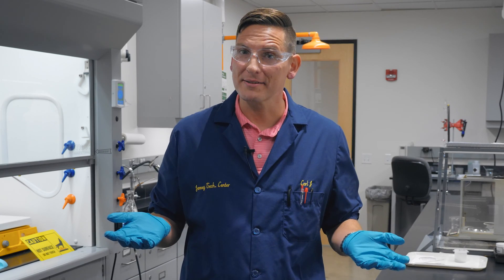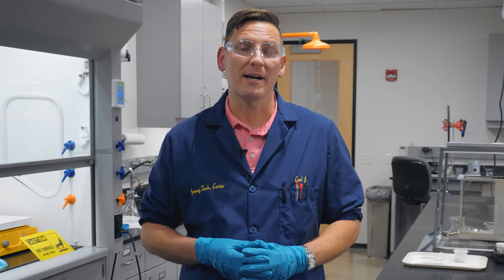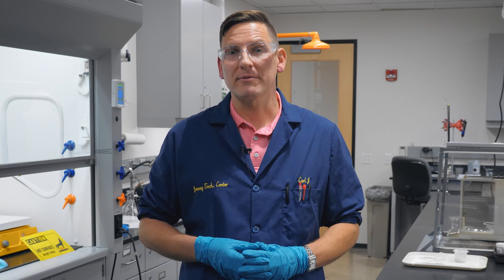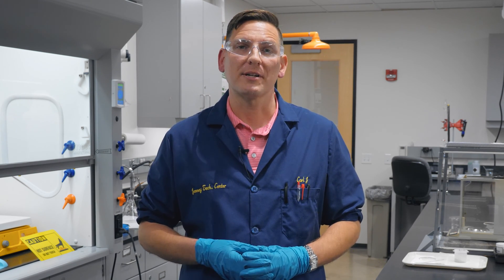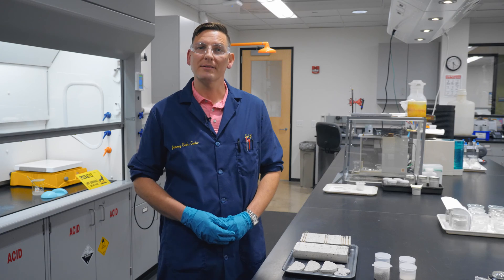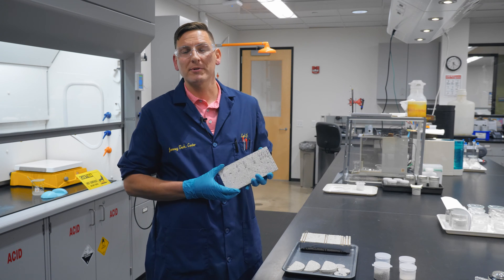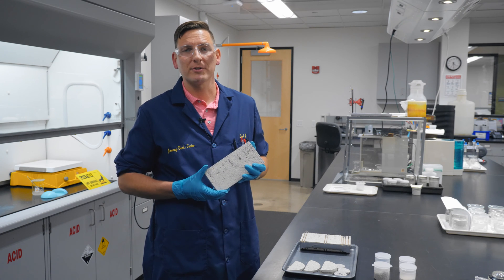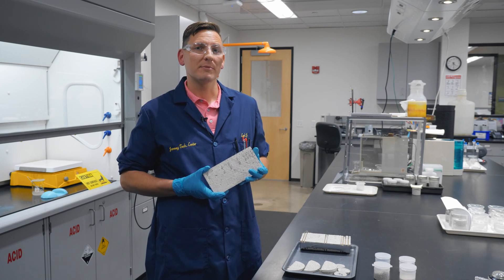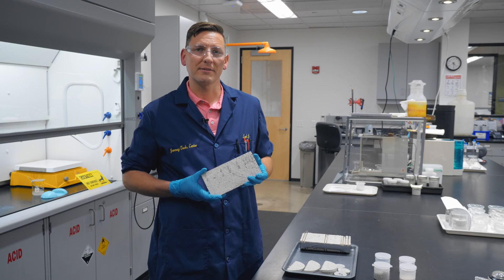What are chlorides? A chloride is a negatively charged chlorine ion. We generally are looking for salts such as sodium chloride and calcium chloride. The sample we'll be testing today is from a reinforced concrete bridge in the Chicago area, which is subjected to chlorides from de-icing salts.